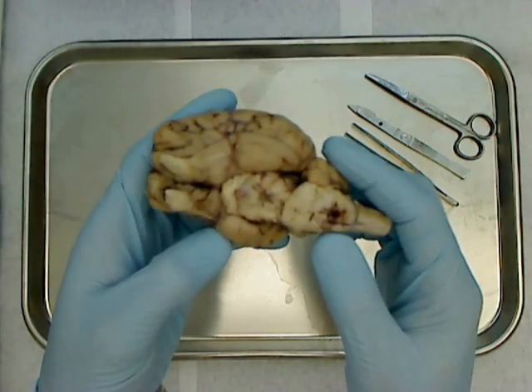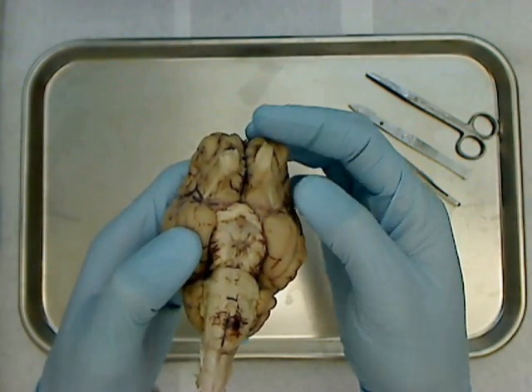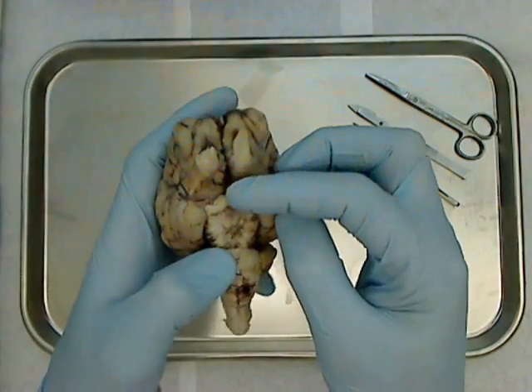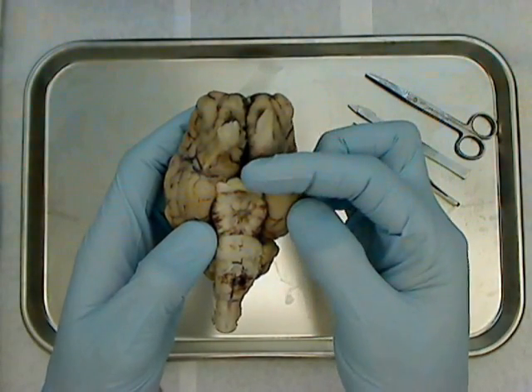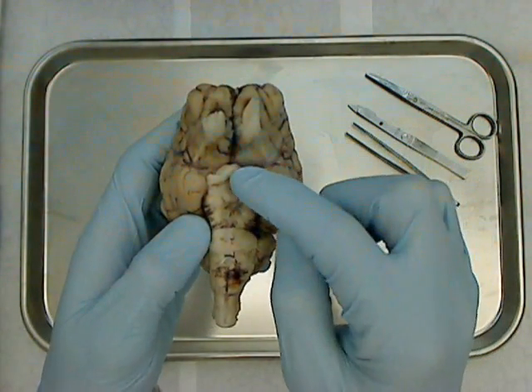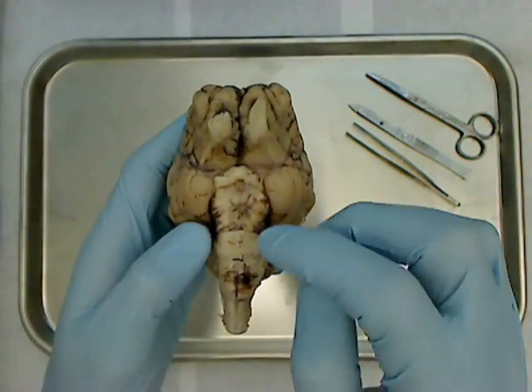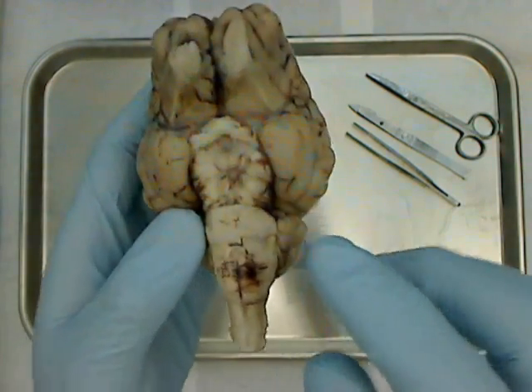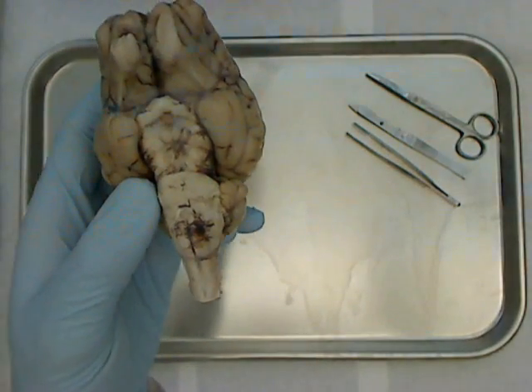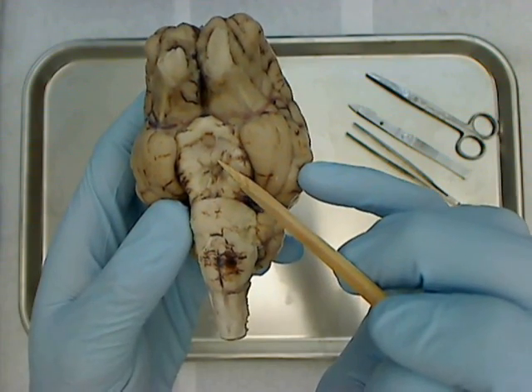Major features you can see from the outside. Cranial nerve number one, or the olfactory nerve, is up here. Cranial nerve number two, or the optic nerve, has been cut off on these sheep brains — it would have come in right here. The optic chiasm is intact. The mammillary bodies are the two little roundish structures you see behind the optic chiasm. There's one here on this side, and there's a mammillary body on this side.